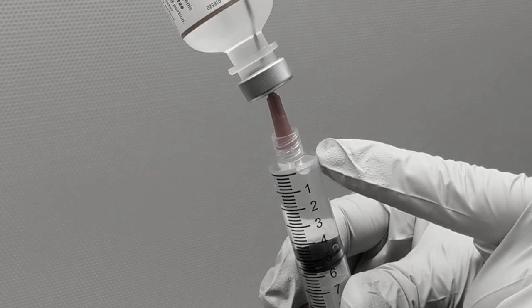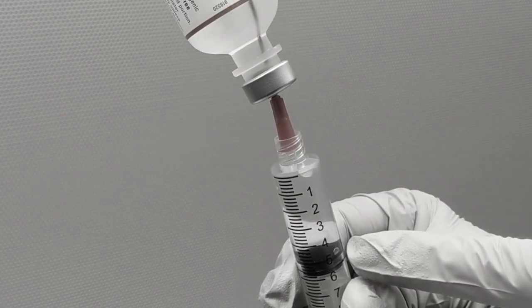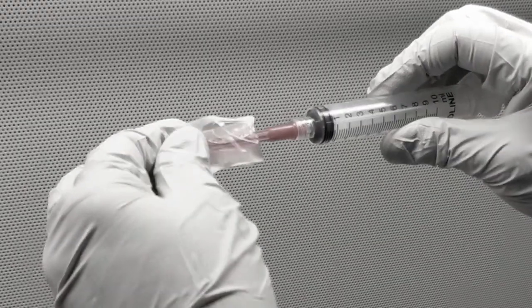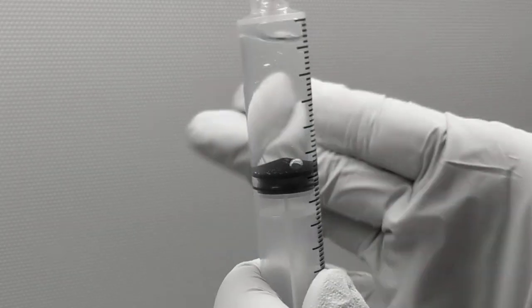Today we are going to draw up five milliliters of sterile water. I'm going to show you the technique for putting the needle on the syringe, how we draw it up, and how we get rid of air bubbles.